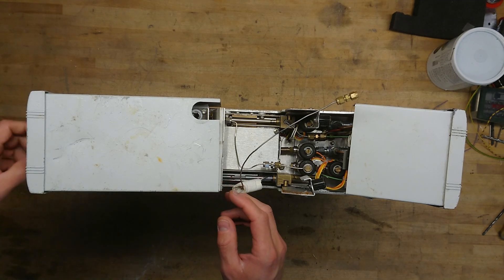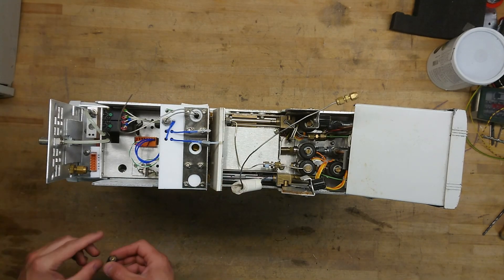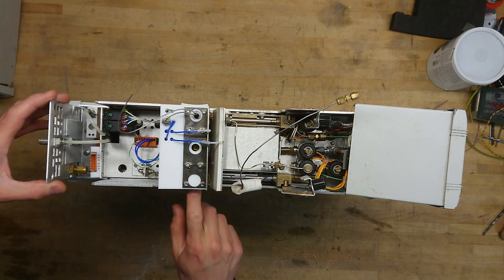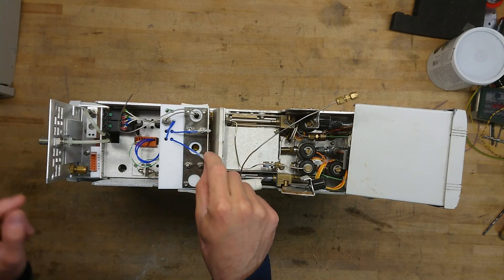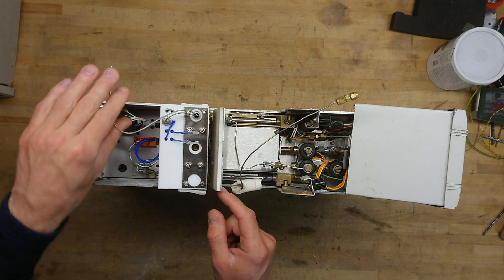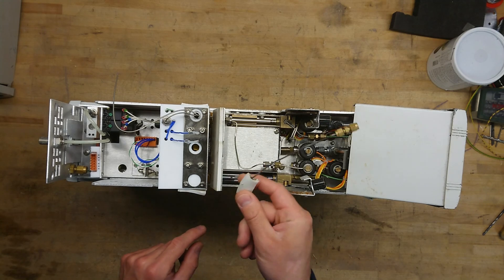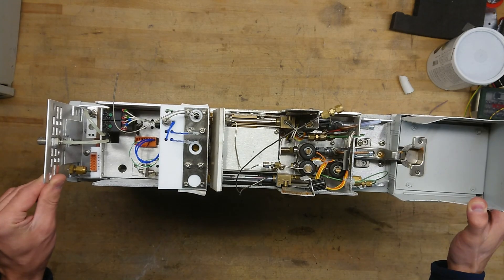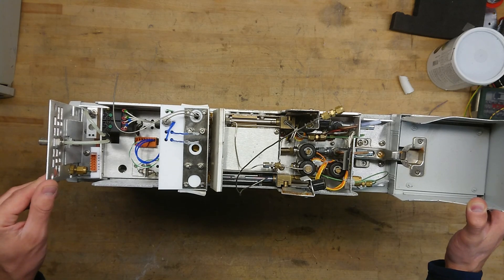The whole back shield can be removed just by this small knob here. Back here, there should be a heated valve perhaps sitting underneath this part. It's kind of hard to see, and as we can see, this has been torn apart from being thrown out. Some of the connections are broken and pulled off, so it's not in quite as good shape as one could hope for. Let me just get as much of this disassembled as possible so we can take a look further inside the unit.